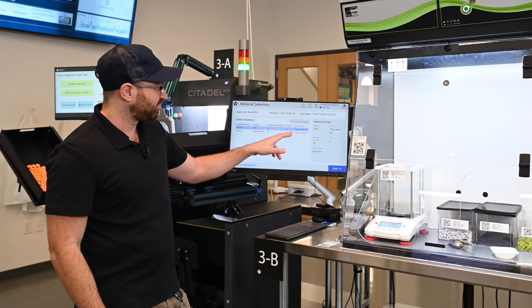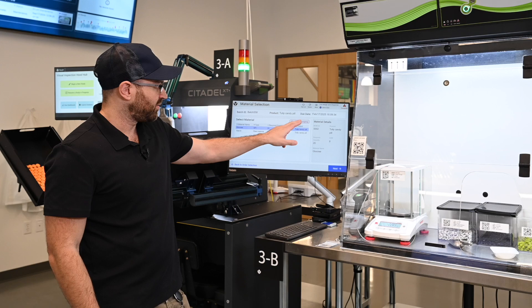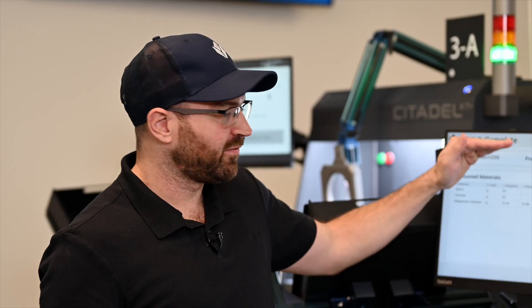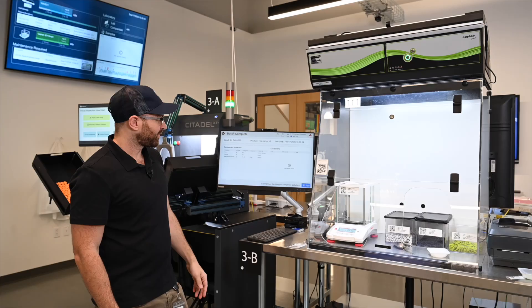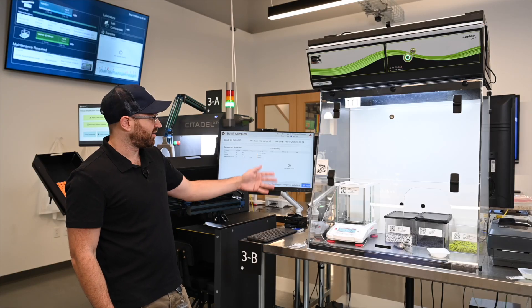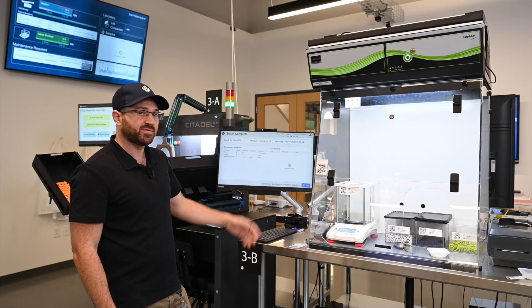Now to simulate this, I'm just going to go ahead and push this button. At the end, I can review the batch I just created, as well as all the materials and how much I put in each one. If there are any exceptions, you can see them here, and we'll be able to review those as well.